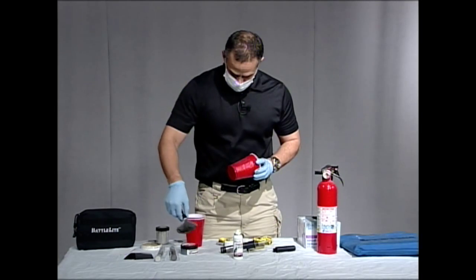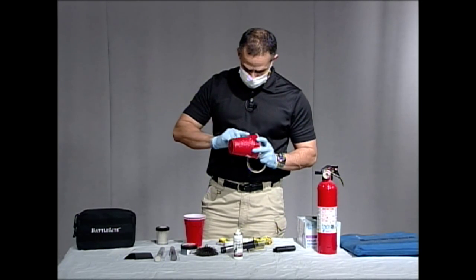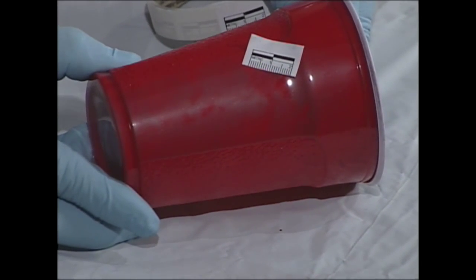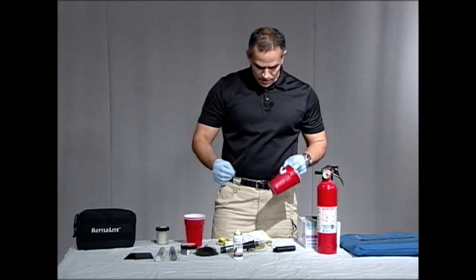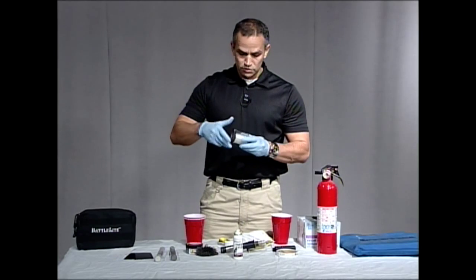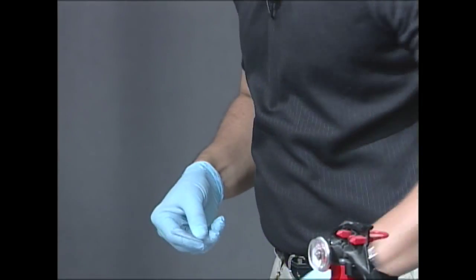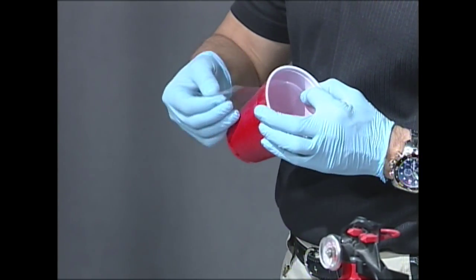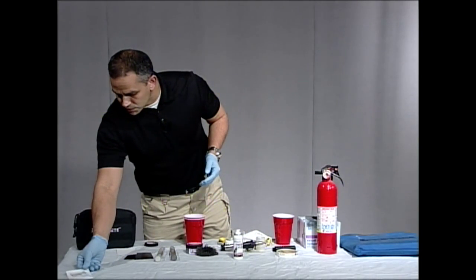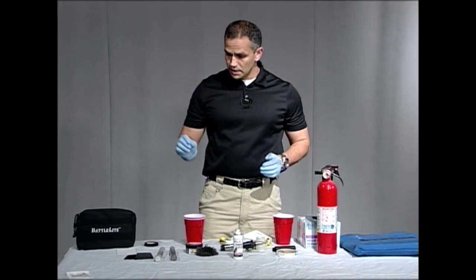Those are beautiful prints. So now I'm going to put this in for a close-up so that you can see the prints that were developed — it's a lot faster than using traditional fingerprint powder. You can see there are fingerprint ridges on here. We can lift that just like any other fingerprint — it's regular powder, just like if we used regular fingerprint powder. You could use tape or a hinge lifter. I'm going to do the old Texas tear, stick it on our backing paper, and put that in for a close-up. That's the real print we got from using the aerosol spray.